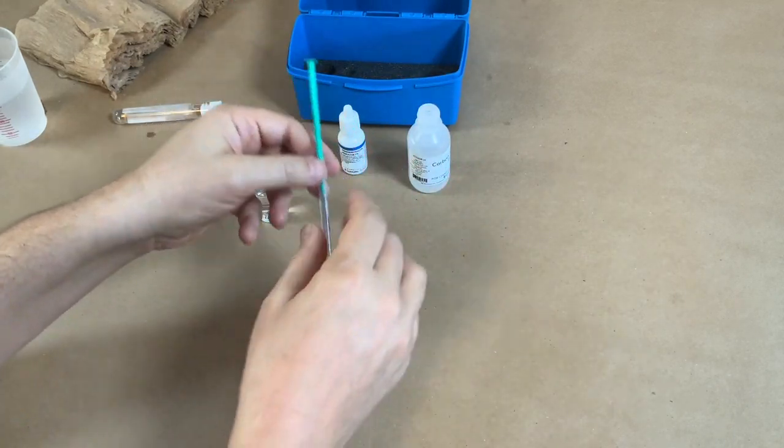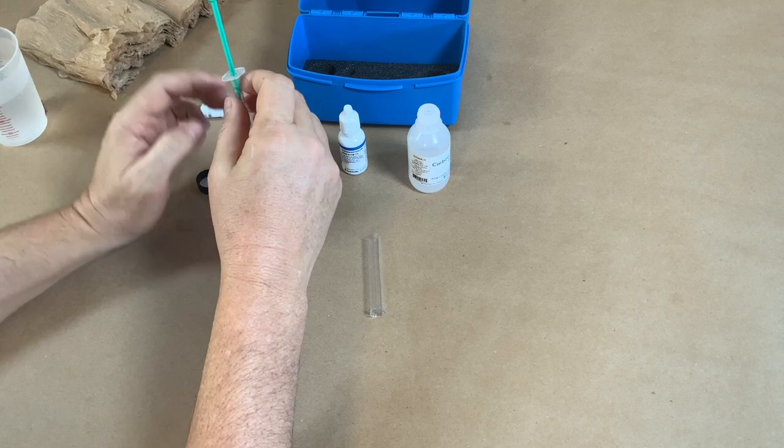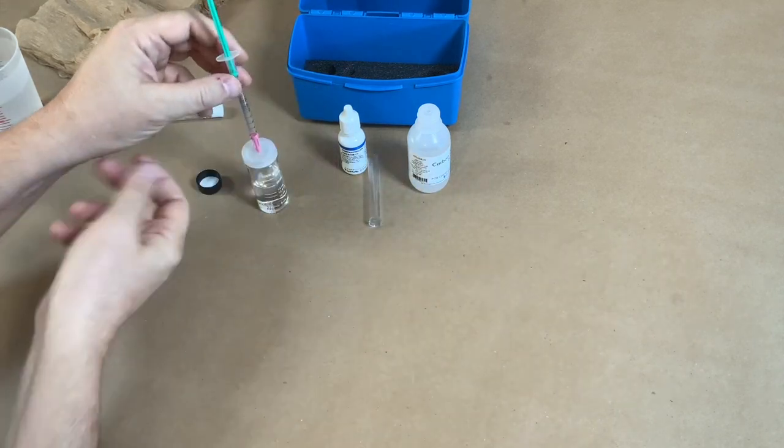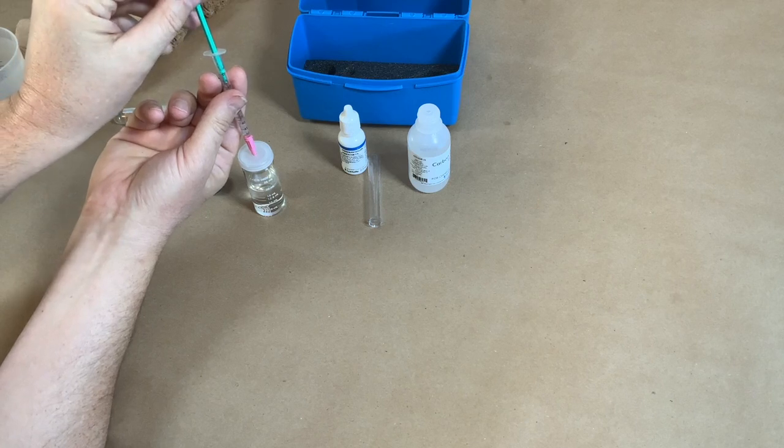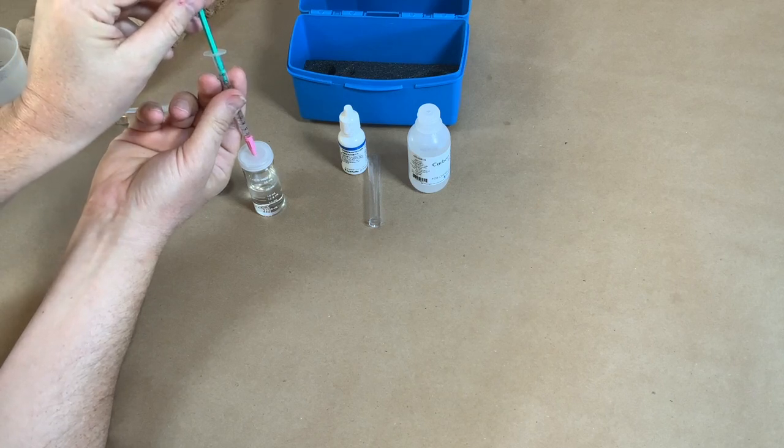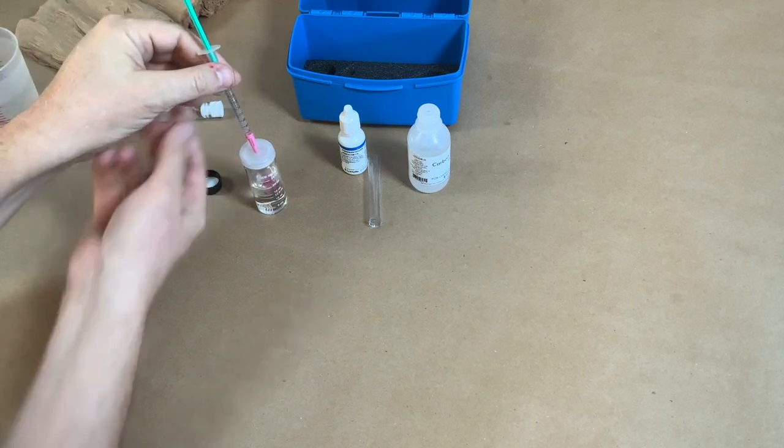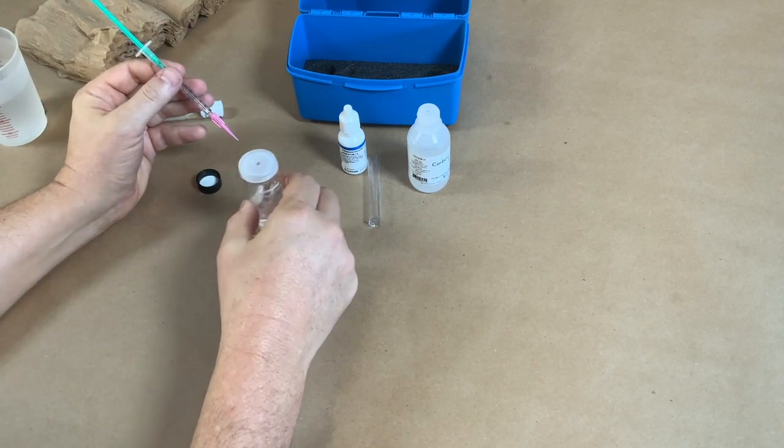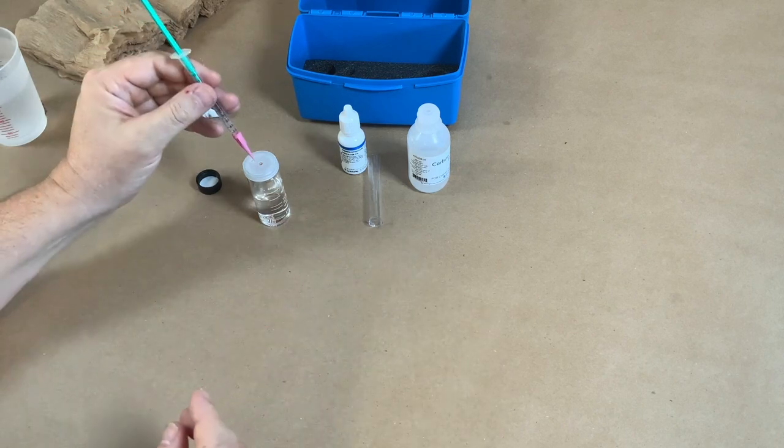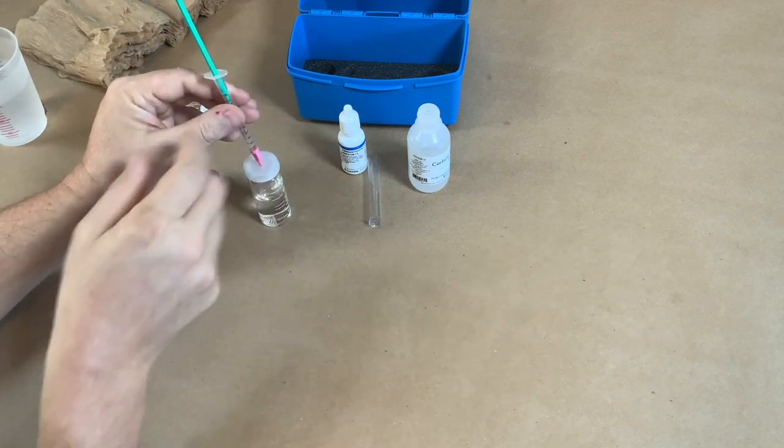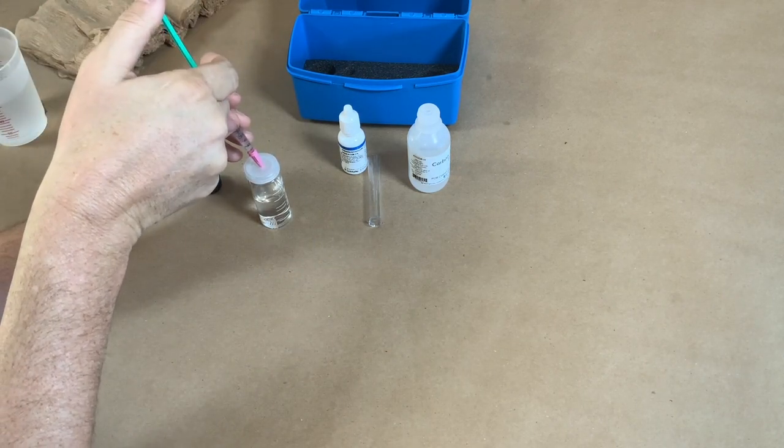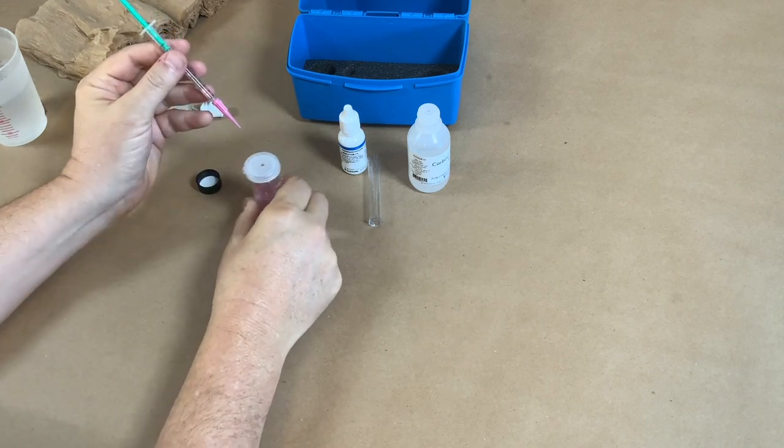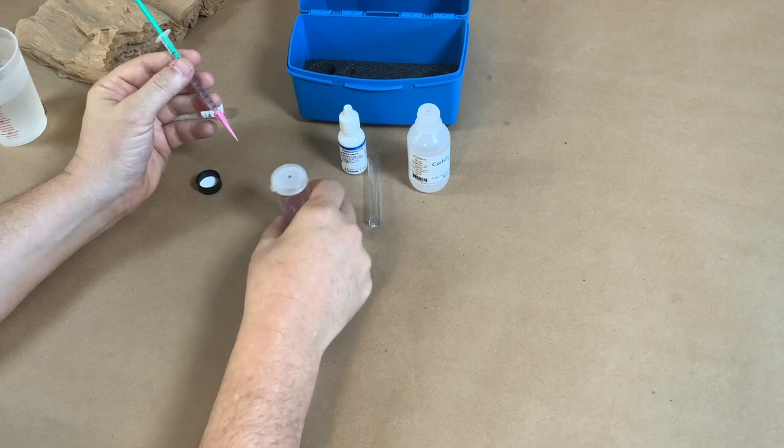We're going to do one drop at a time, so we're going to put this in there and we're going to put in one drop. You can see it turns pink immediately. I think a second drop got in there, but I'm going to shake it up and you'll notice all that pink goes away. So that was two drops. I'm going to do a couple more drops. It'll turn pink a little bit, but we're going to keep stirring it up until the pink doesn't go away.